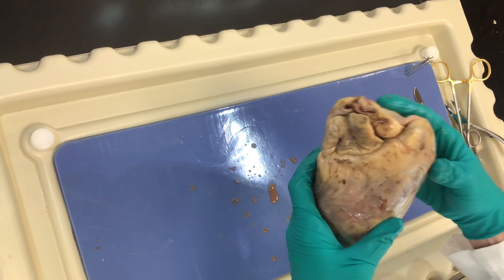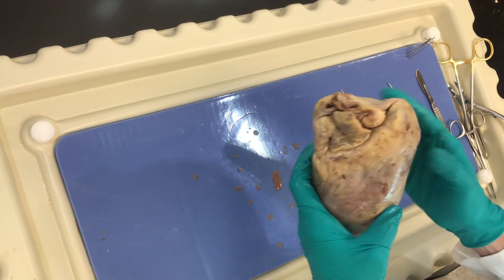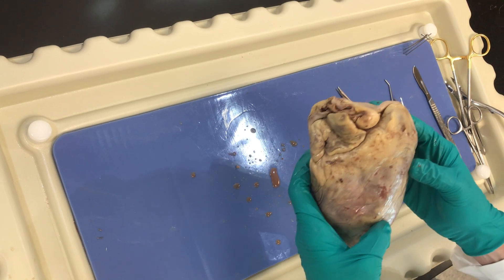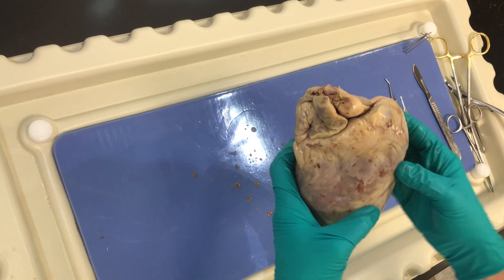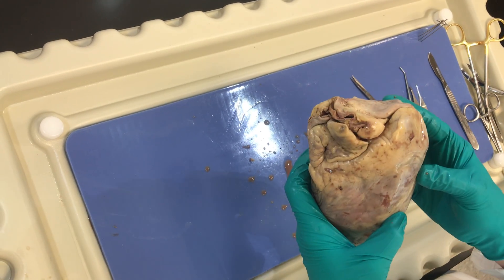Very important: before you get started on cutting, you need to orient yourself and make sure you know where the structures are externally.